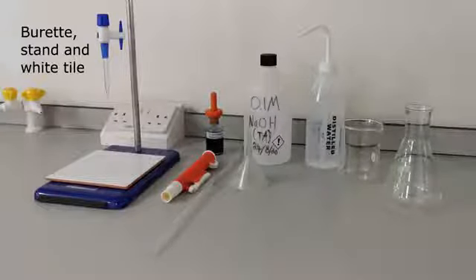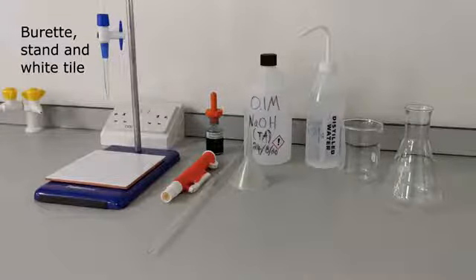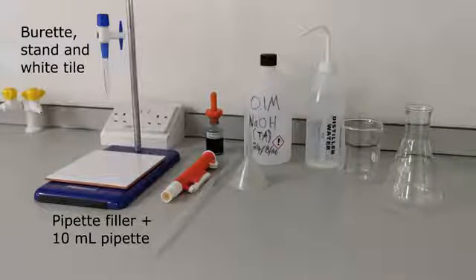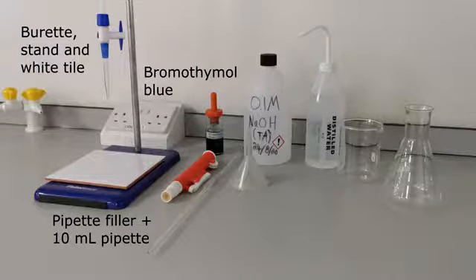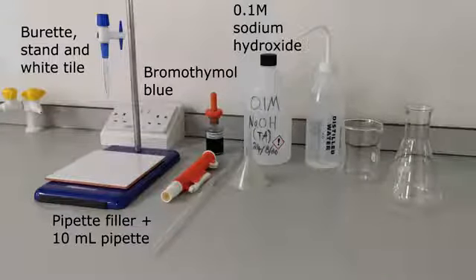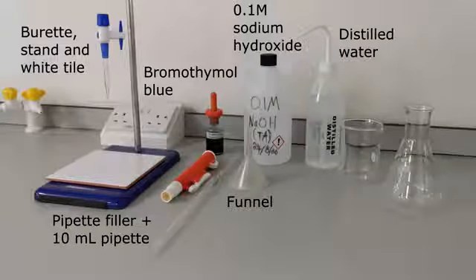You'll need the following: a burette with a burette stand and a white tile, a pipette filler and 10ml pipette, bromothymol blue, sodium hydroxide at 0.1 molar concentration, a funnel, distilled water, a beaker and a conical flask.